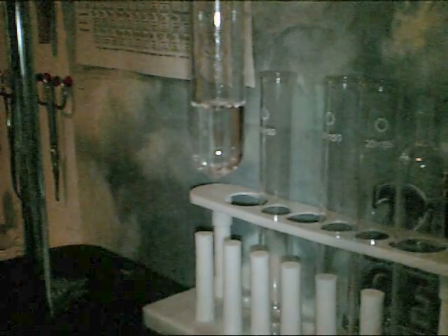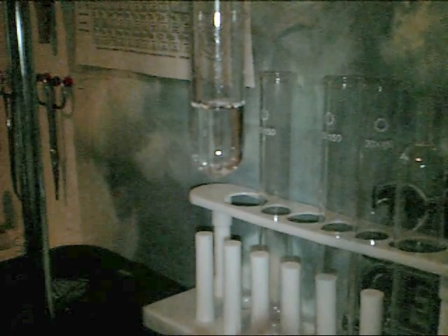As you can see here, I have a very small amount. I'm not going to go precise, but I'm going to do a visual representation of what you would do. So take your Bunsen burner, or whatever you have, and then you heat up your hydrogen peroxide.